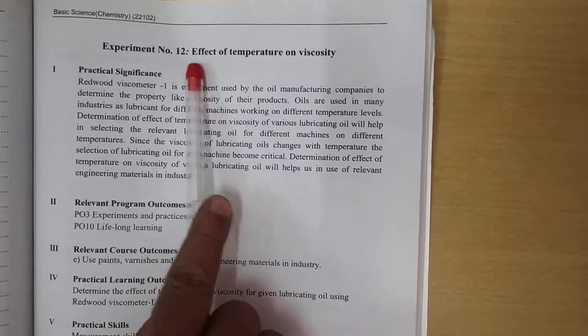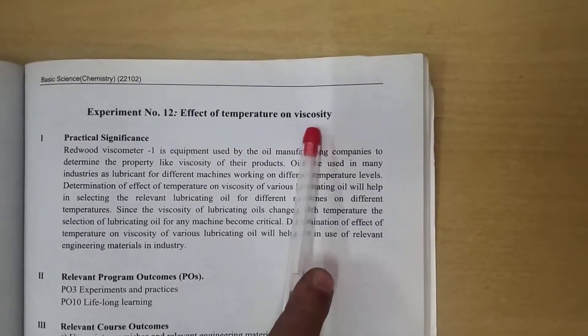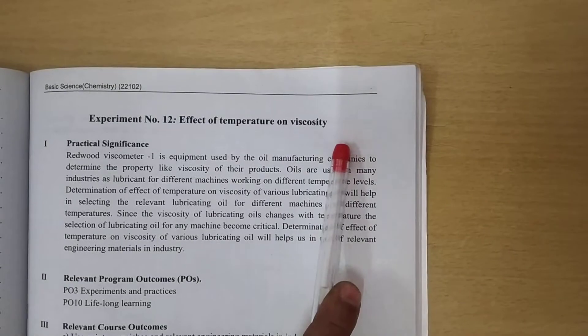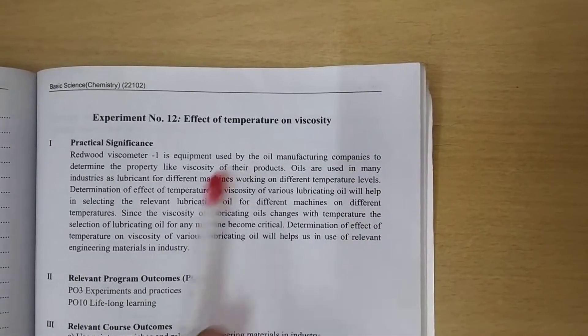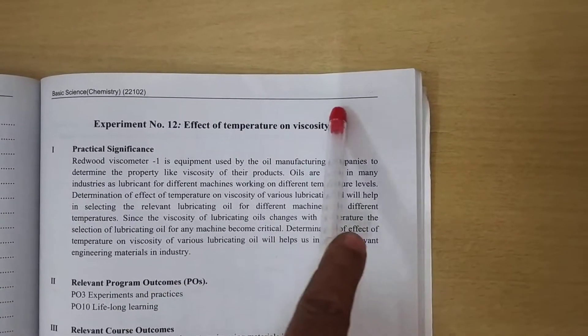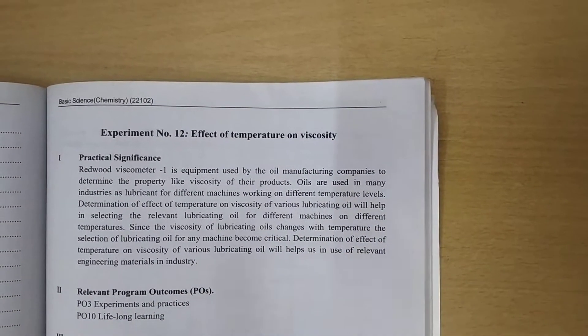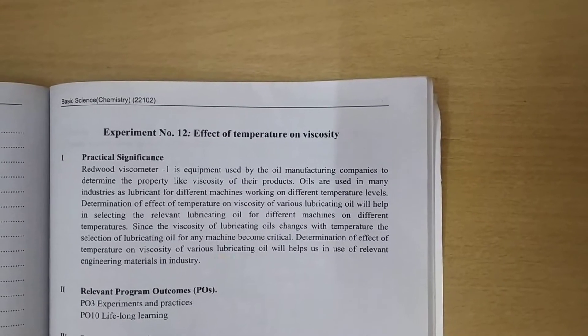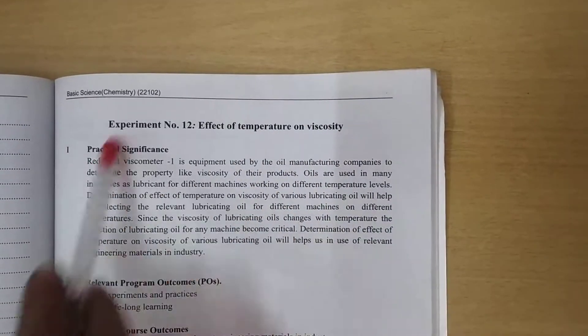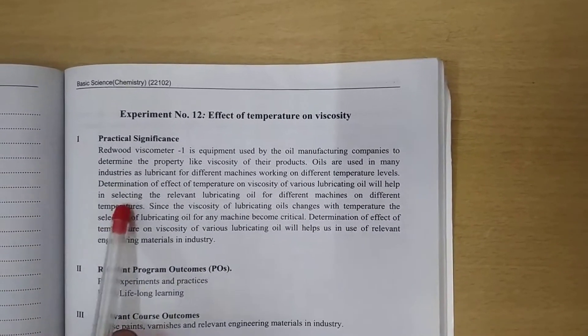My experiment number 12: effect of temperature on viscosity. If temperature goes on increasing, what happens to the viscosity? Generally, viscosity goes on decreasing. This is studied in these practicals.